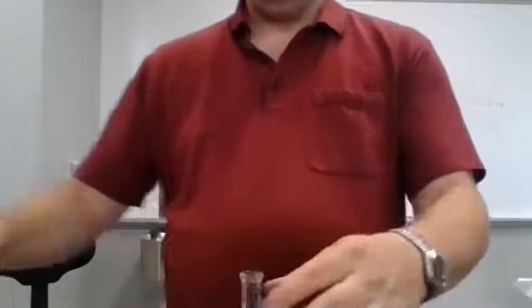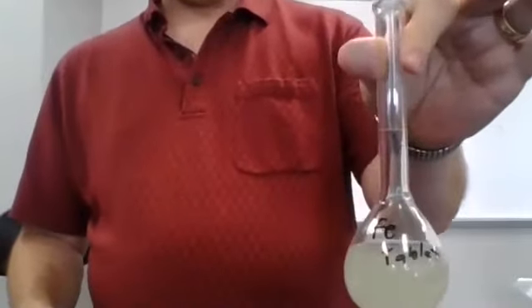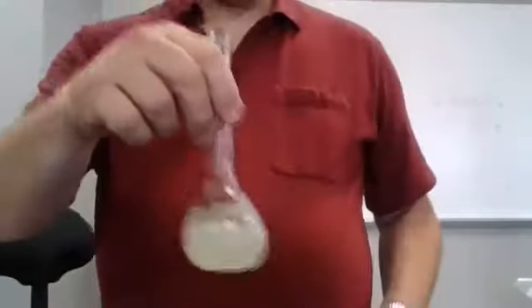So here you see the iron tablet. We will come back to that. Notice I haven't filled it the rest of the way with the nitric acid. We will come back to that. If I leave it sit here, it will dissolve a lot better.